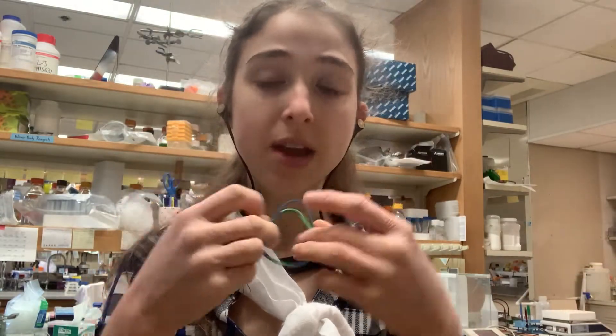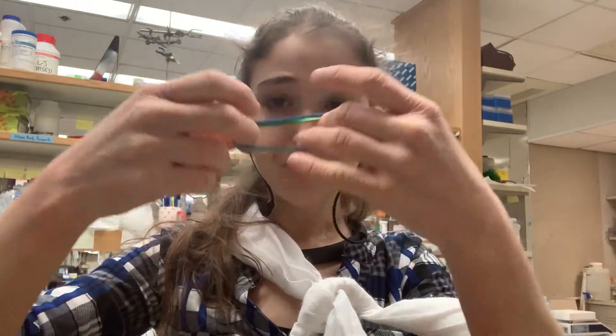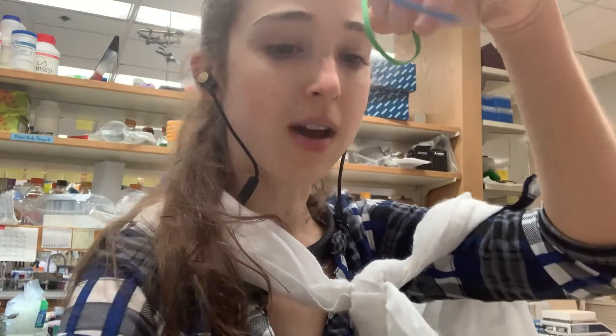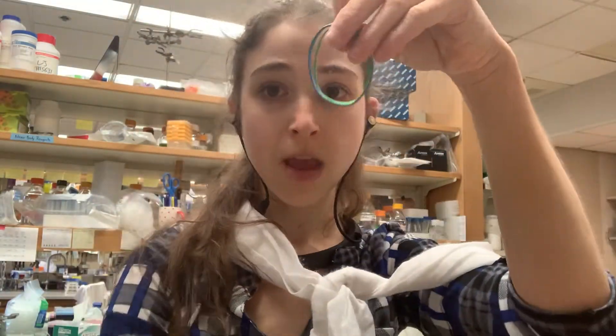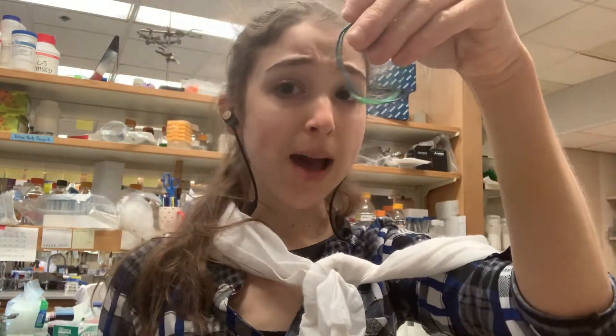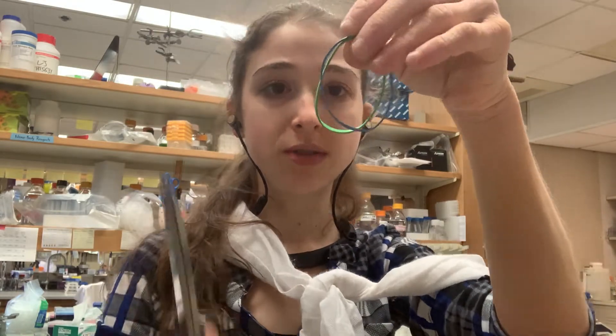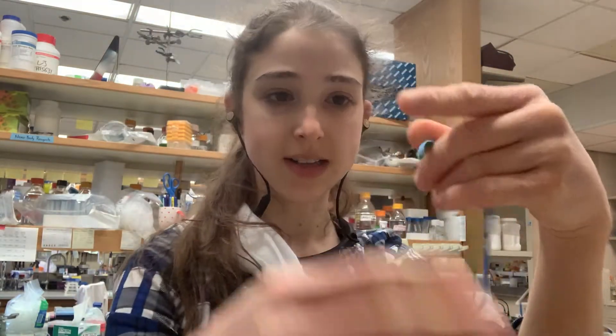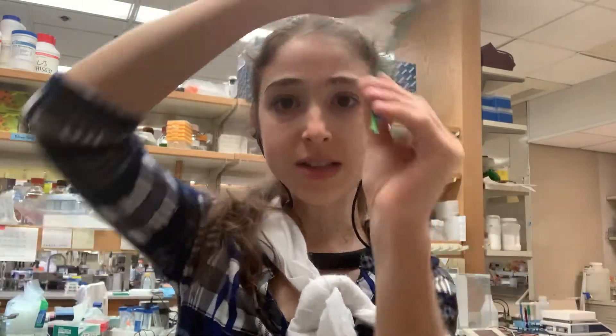So basically, when you have a plasmid, it's double-stranded DNA. If you have this double-stranded circular plasmid and you were to linearize the DNA — cut both strands and make it linear — now it's going to snake through the gel like normal. It will travel like normal, it'll make sense with your ladder, all's good.